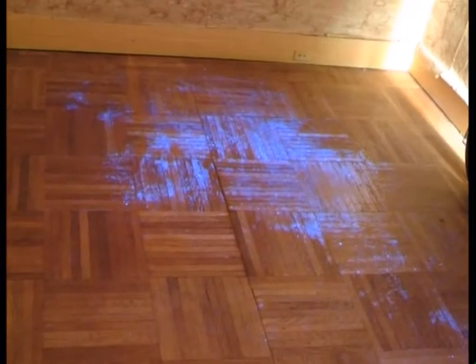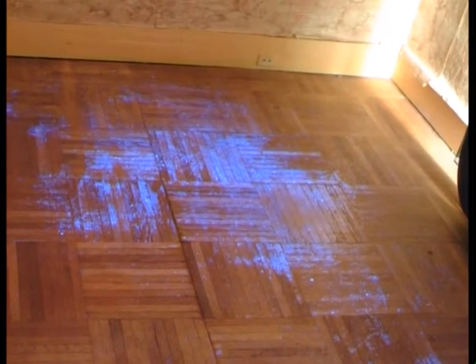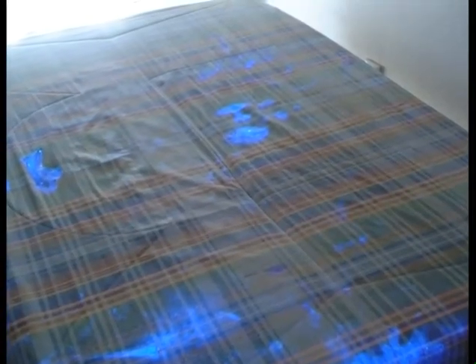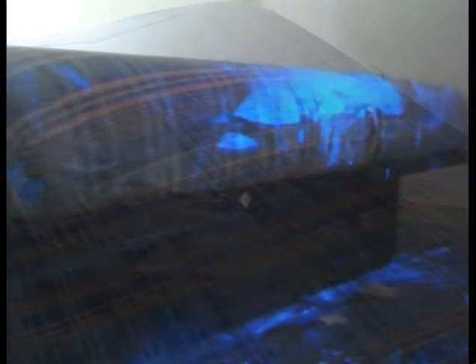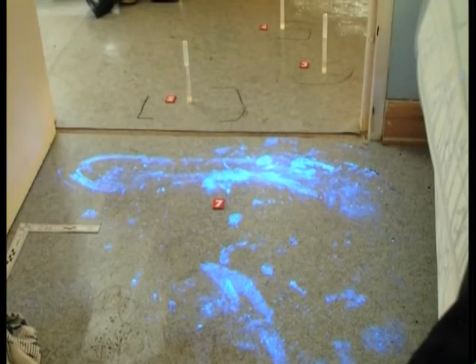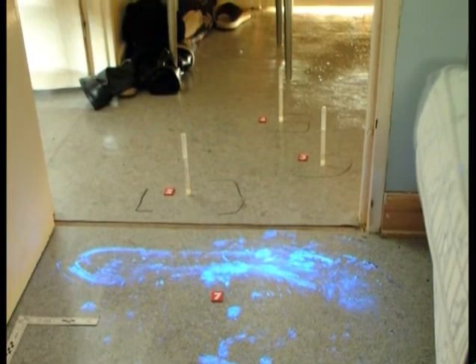We have just worked near a window. Even though the blinds are closed, residual light enters. The zone will be a little brighter than a zone in the room that is completely hidden from any light source, such as behind a desk or behind a bed where it will be darker. In contrast, at the bottom of a door, the gap under the door will let in a lot of light and may harm the quality of the picture. These light and dark adjustments must be made throughout the course of the scene.